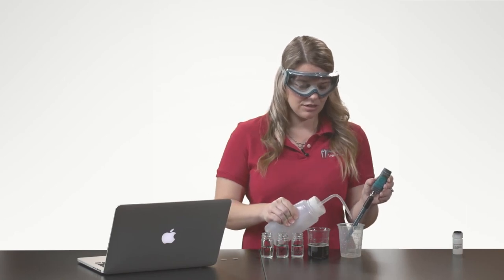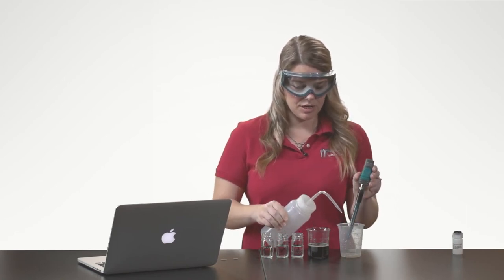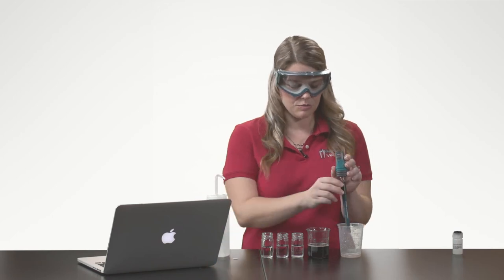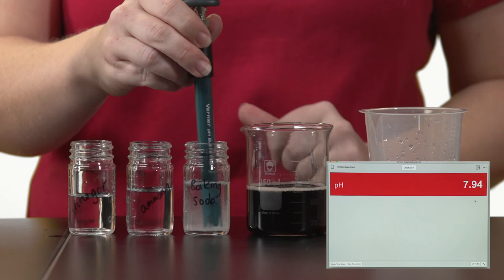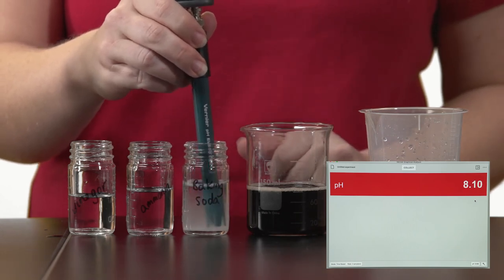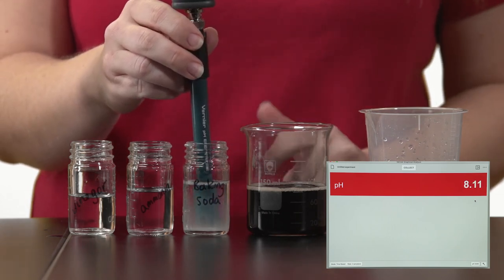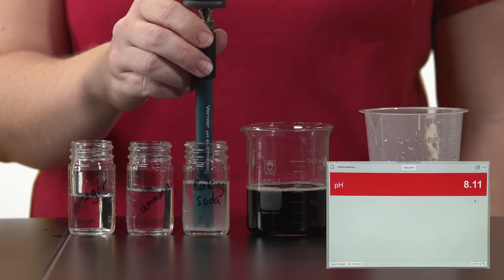My final solution is baking soda dissolved in some distilled water. Once that reading stabilizes, I'll write it in my laboratory notebook.